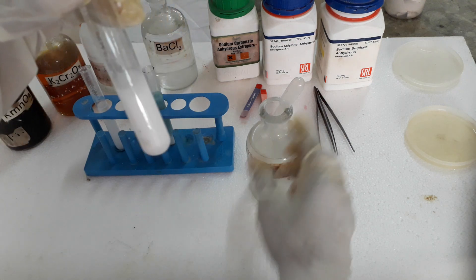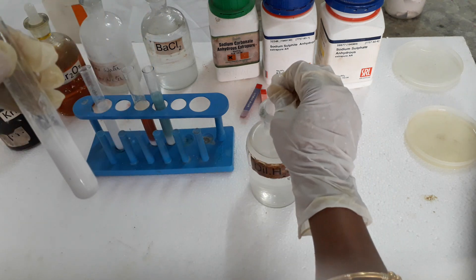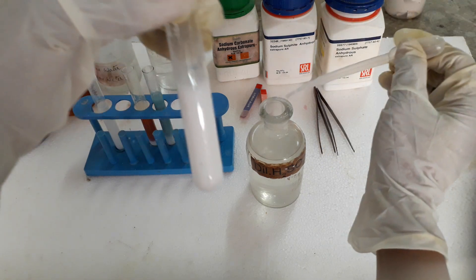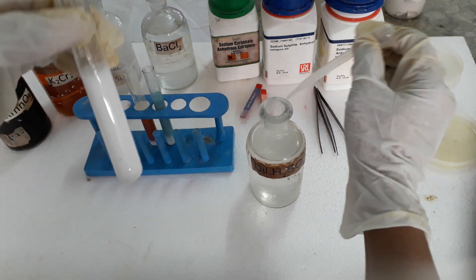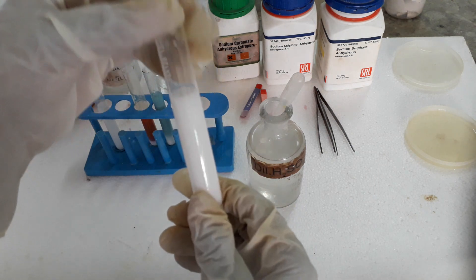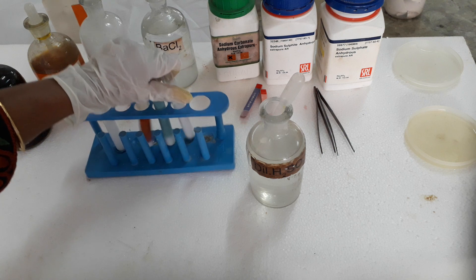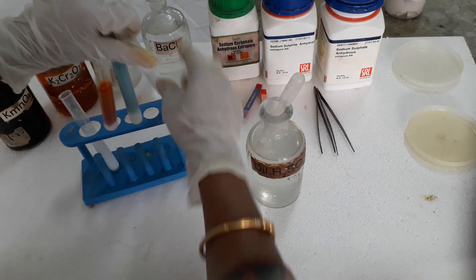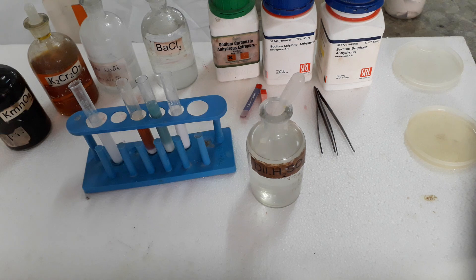Now for sodium sulphate — to which we already added barium chloride to form barium sulphate — on adding dilute sulphuric acid, the barium sulphate white precipitate remains as it is. No change. This confirms that it is the sulphate anion present in the salt. So all three anions — carbonate, sulphite, and sulphate — have been detected. Thank you students.